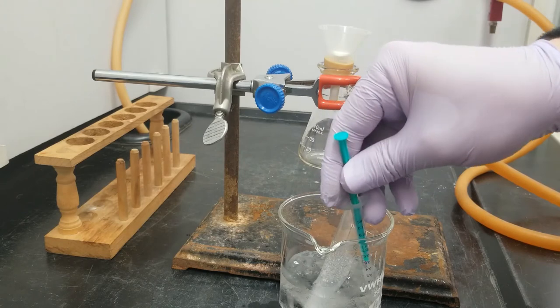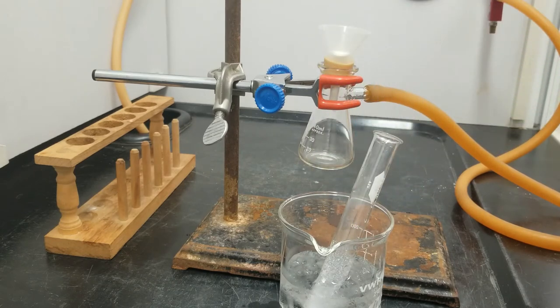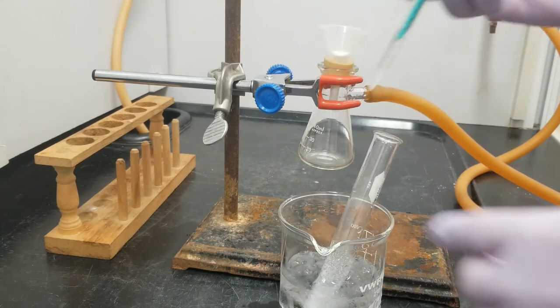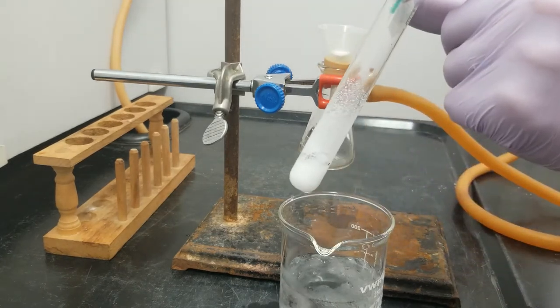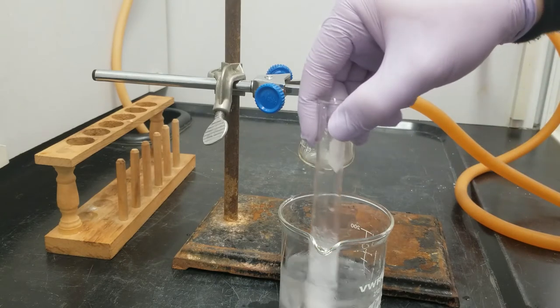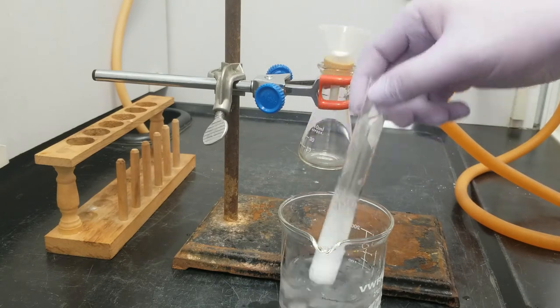So, as per the instructions, just to make sure that we are getting the full precipitation of our products, I'm going to add another half milliliter of ice water. And get that nice and cold.